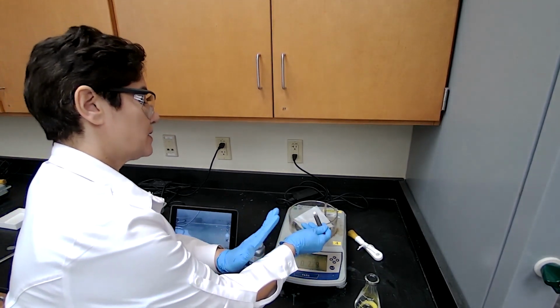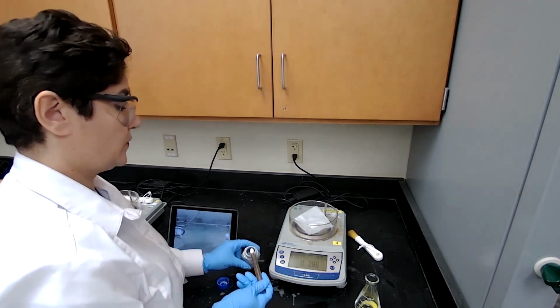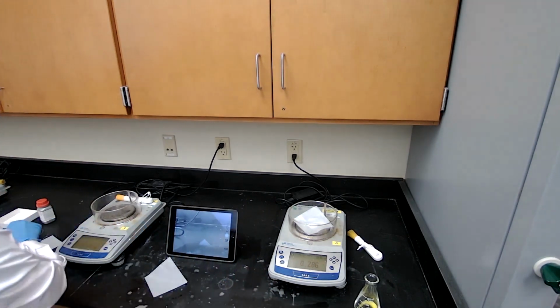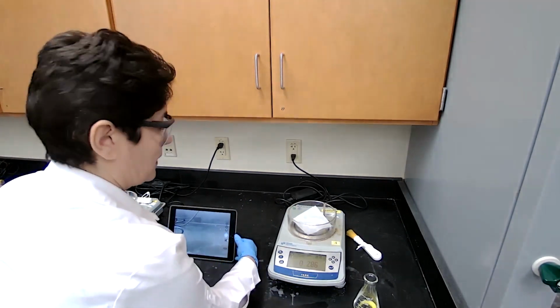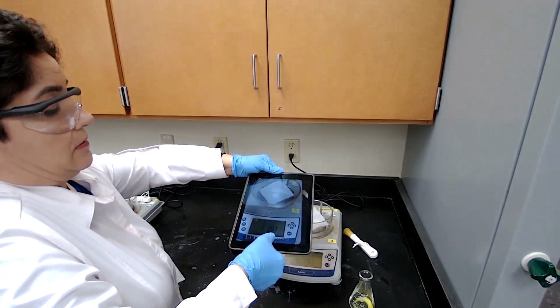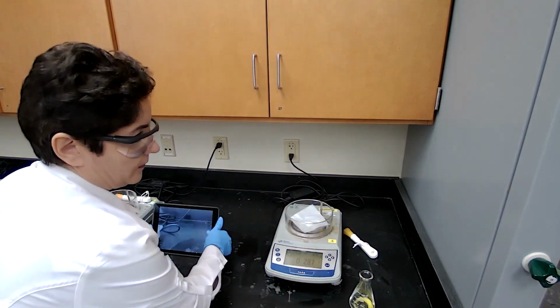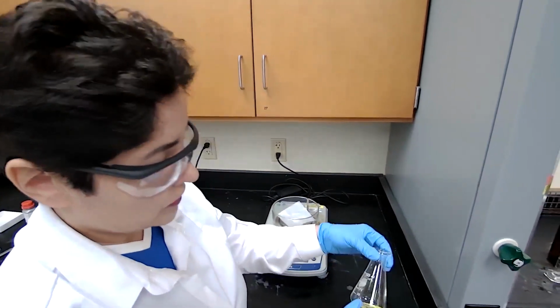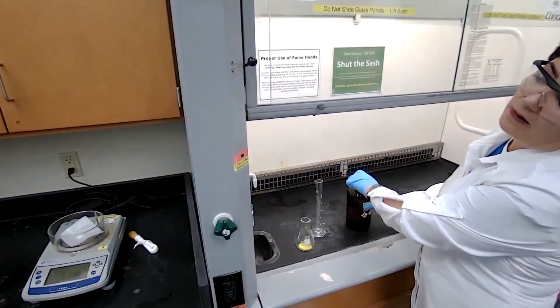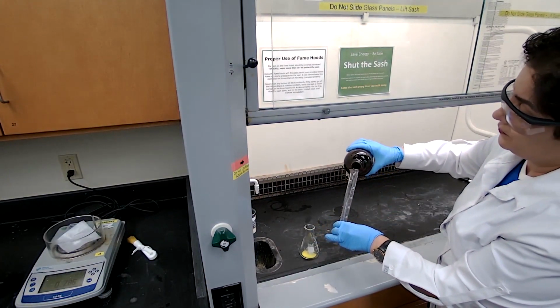as needed. So I kind of went in between now, so I'm adding 0.286 grams of the sodium borohydride this time. To the fluorenone, we are going to add the methanol, and we add the reducing agent to the solution of the fluorenone.